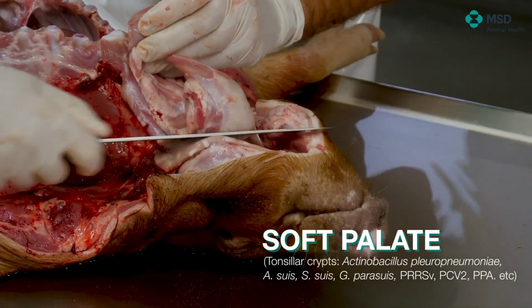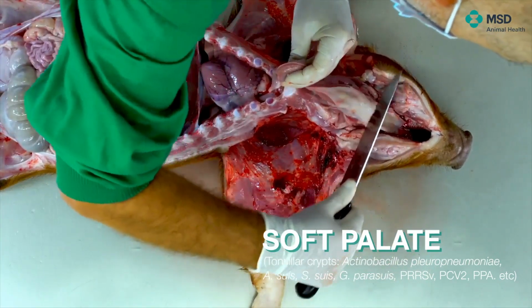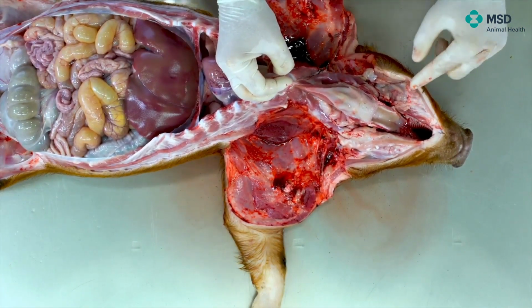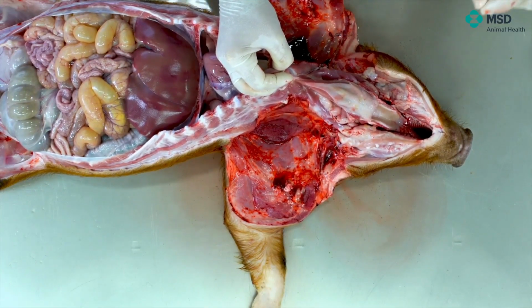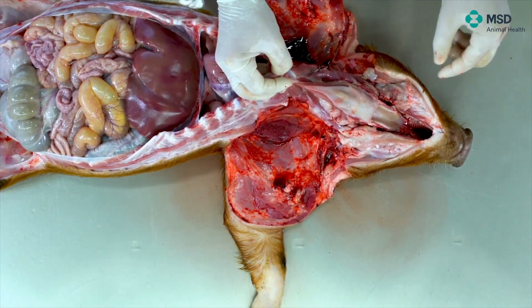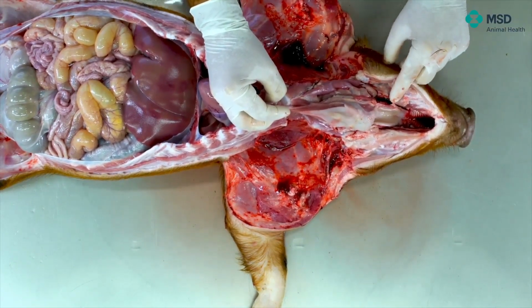So from this point of view, I would like to emphasize the tonsil, because the tonsil is a typical place of replication of different viruses, which are in general terms of systemic or sometimes respiratory effect, or even different kinds of bacteria. So this is an area which is also especially important when we are dealing with important diseases like African and classical swine fever.